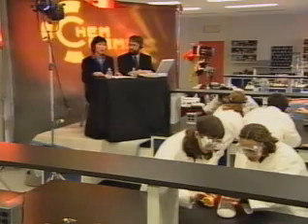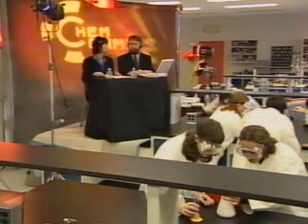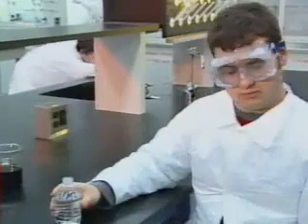It's probably safe to say that when you're in the lab, you shouldn't put anything in your mouth. Safe to say and safe to do. When you're in the lab, don't taste the chemicals and don't drink out of the equipment.